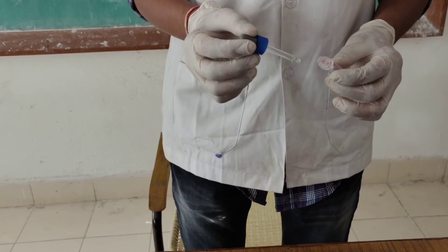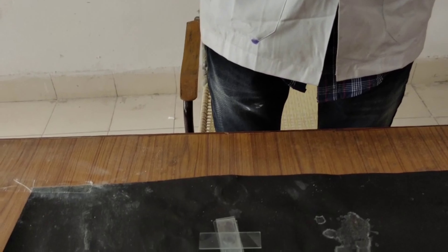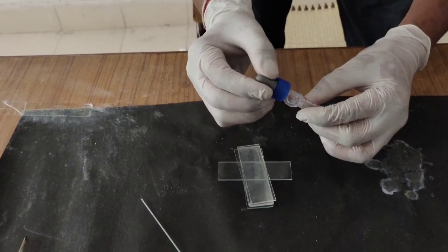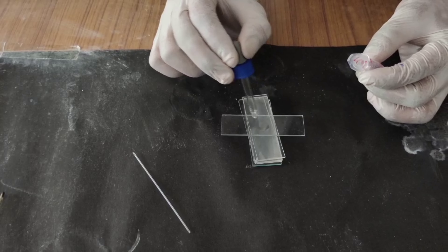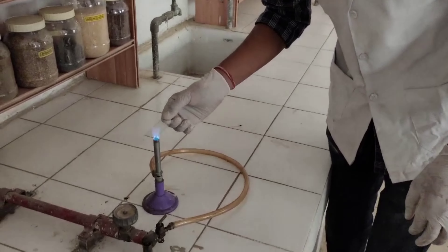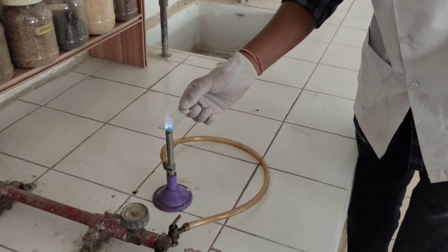And now we will start the procedure. The first step of the procedure is to prepare the bacterial smear. After preparation of the bacterial smear, we will heat fix it.